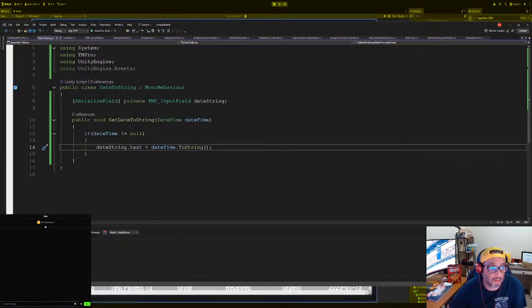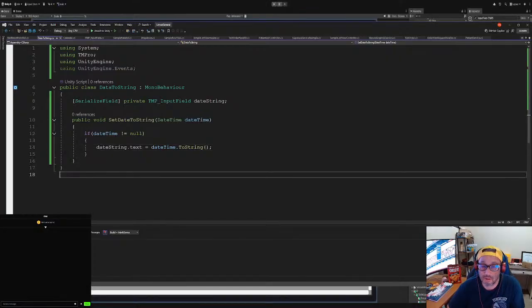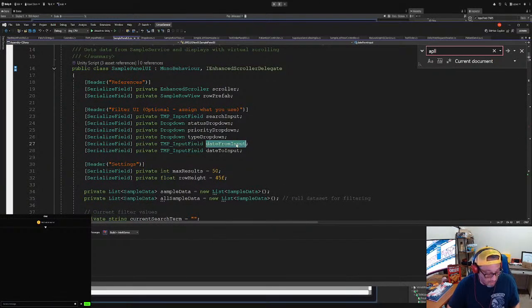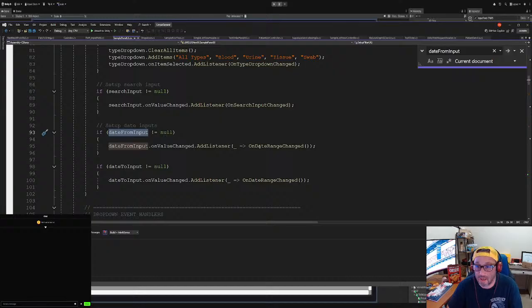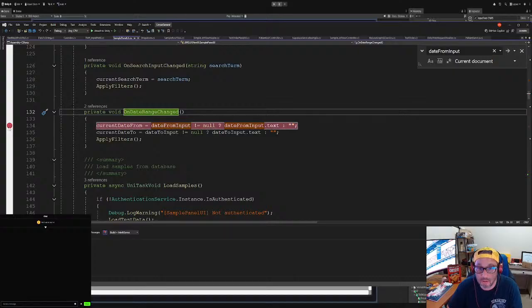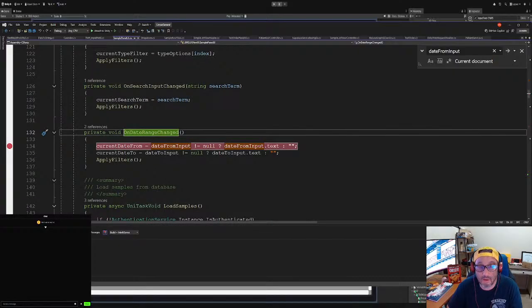You just offset a little bit. There we go. Okay. Doesn't seem to be okay from the date 115, 115. No, no. Okay, so there's something here. We gotta double check on our work. We are gonna go to sample panel, date from, see, add listener. Okay, so we're gonna put a stopper here. Right, and then see if it's working.